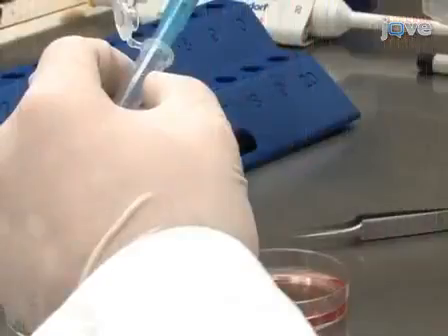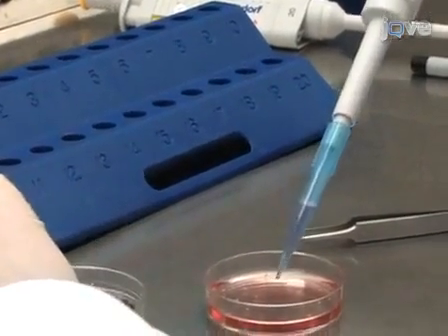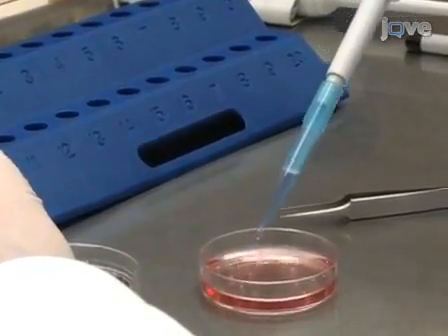Hi, I'm Michael Silverman and welcome to my laboratory for cellular neuroscience at Simon Fraser University. We're interested in how organelles move in nerve cells. To approach this question, we label membrane-bound organelles, specifically dense core vesicles, in cultured hippocampal neurons. And to show you how we do this, I'm going to turn it over to David.